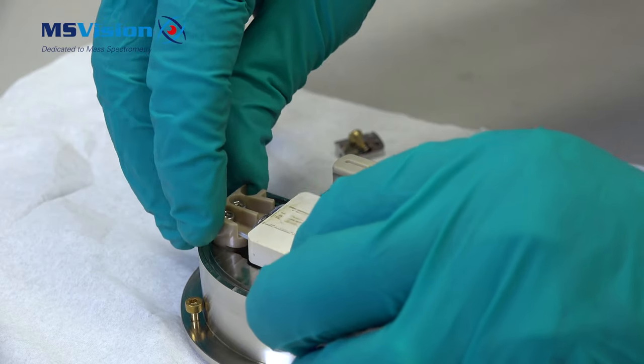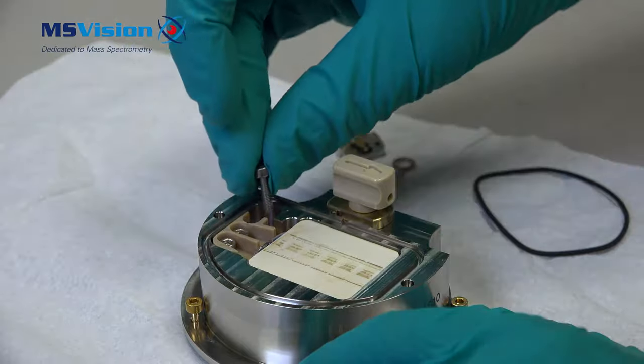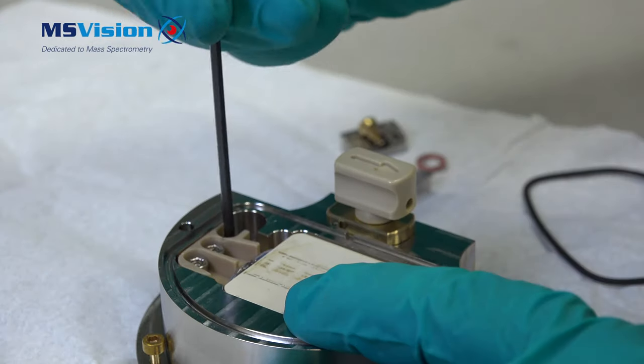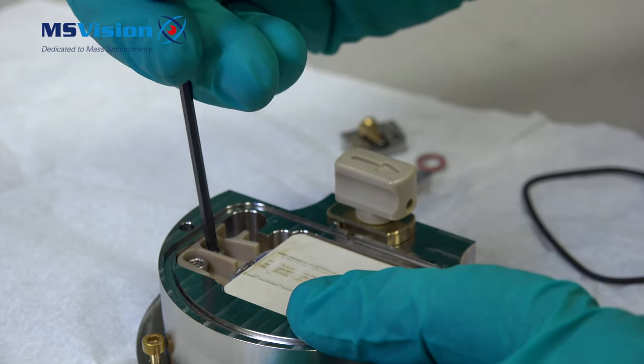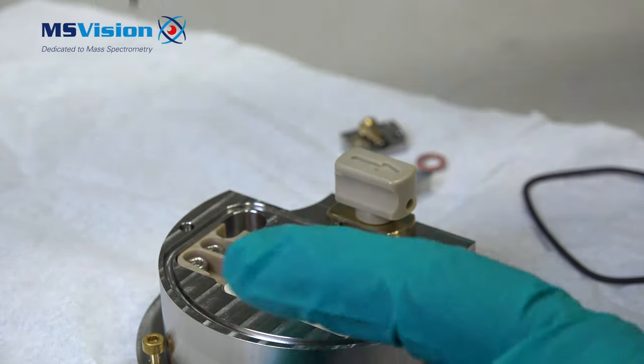The heater does not require cleaning. Refit the locating screw. Check if these two screws are still okay. Don't over tighten these.